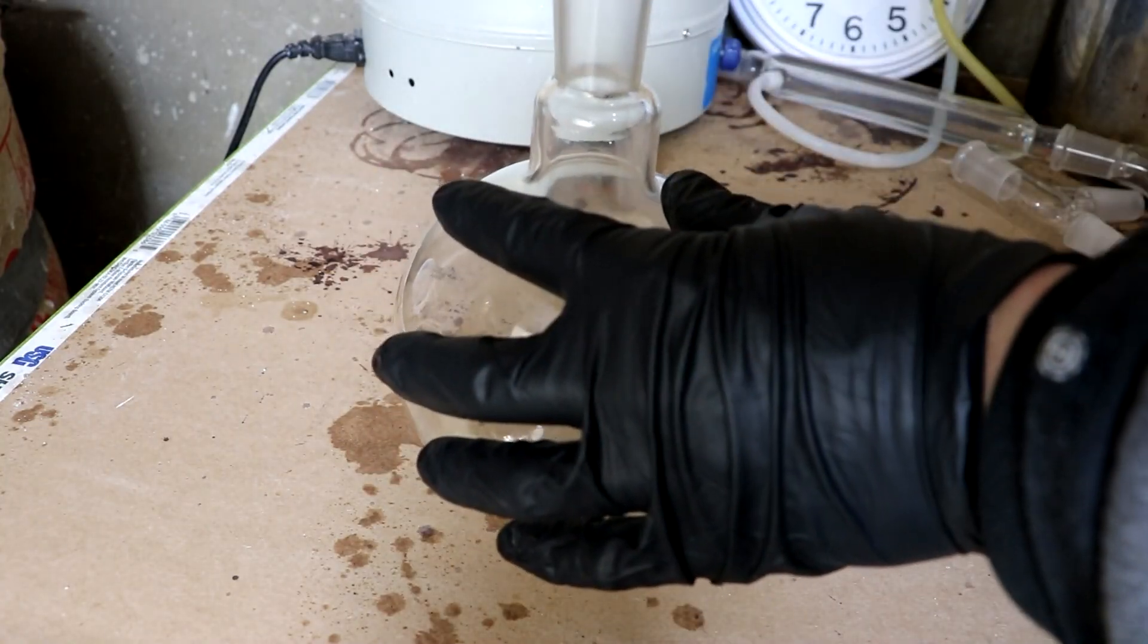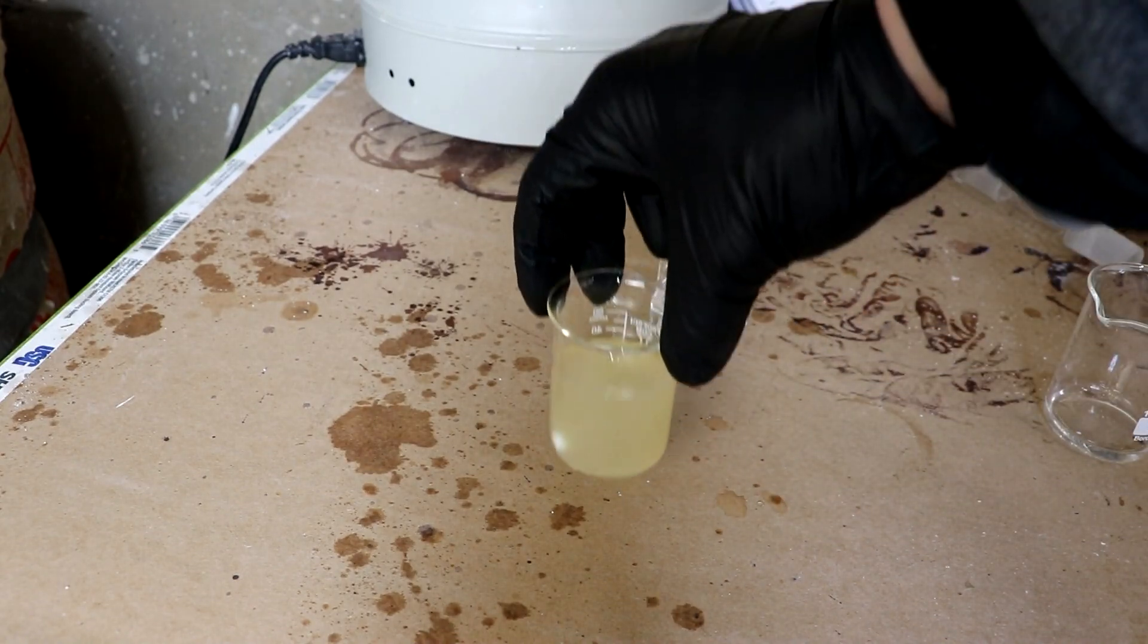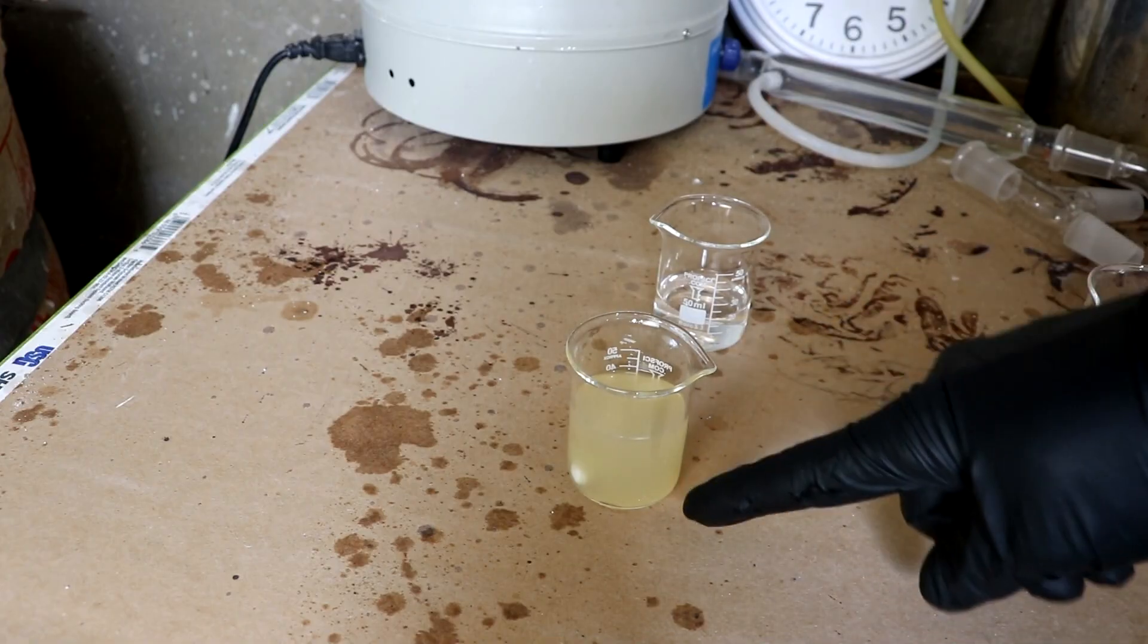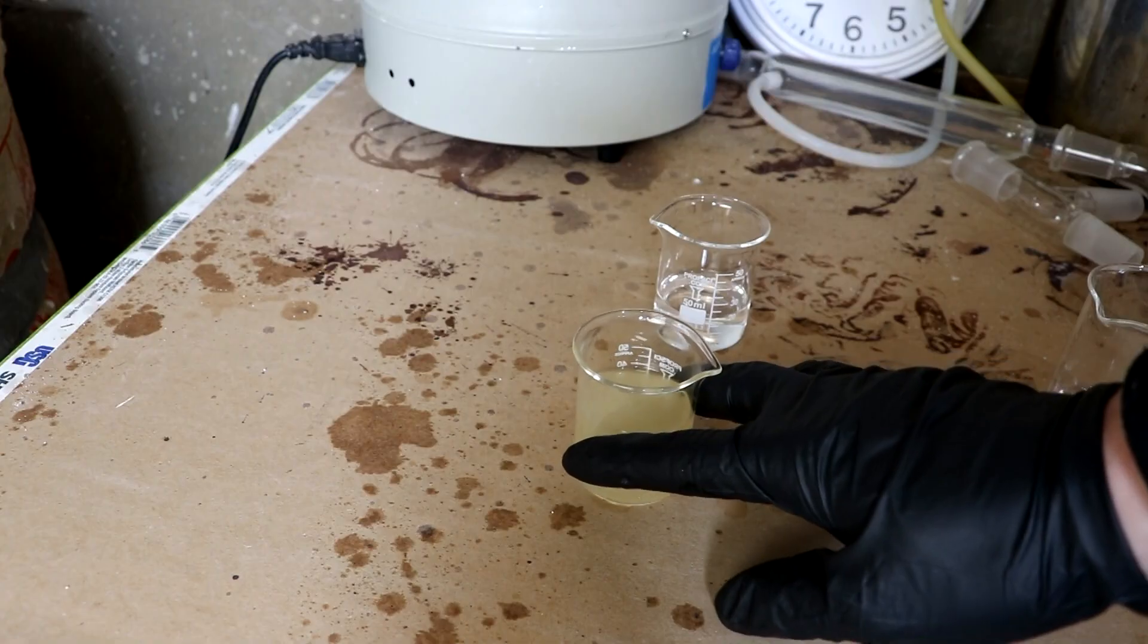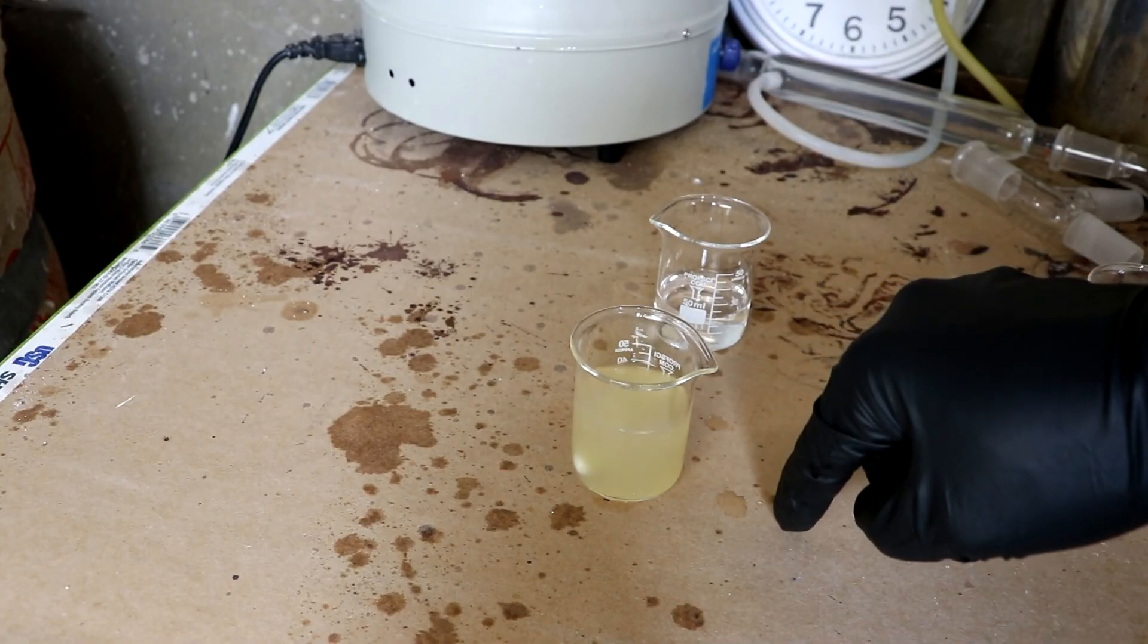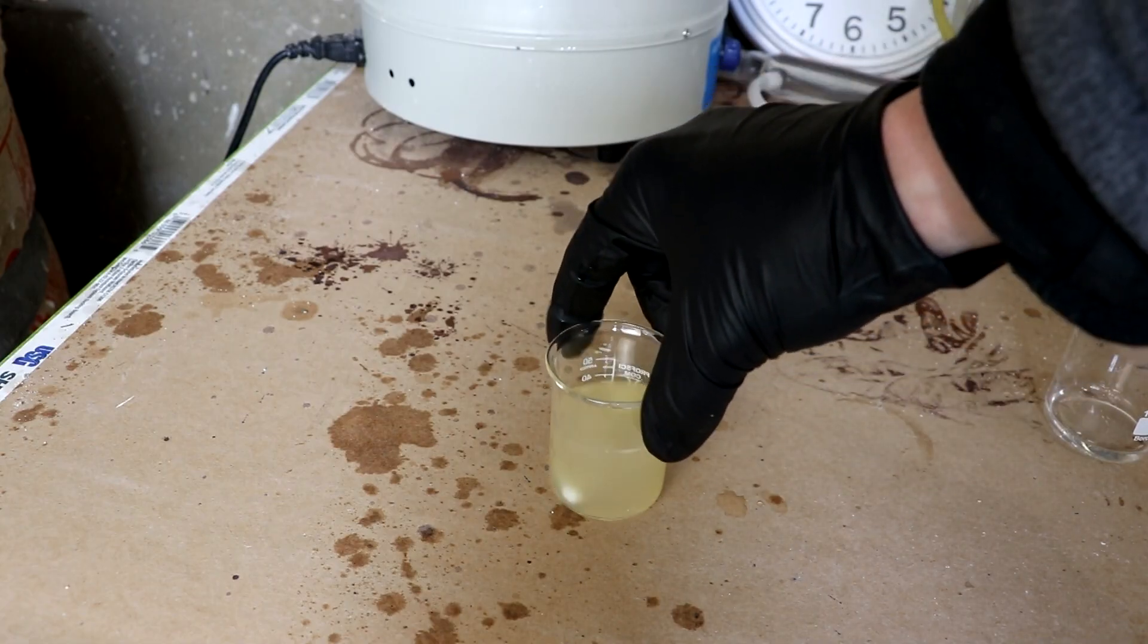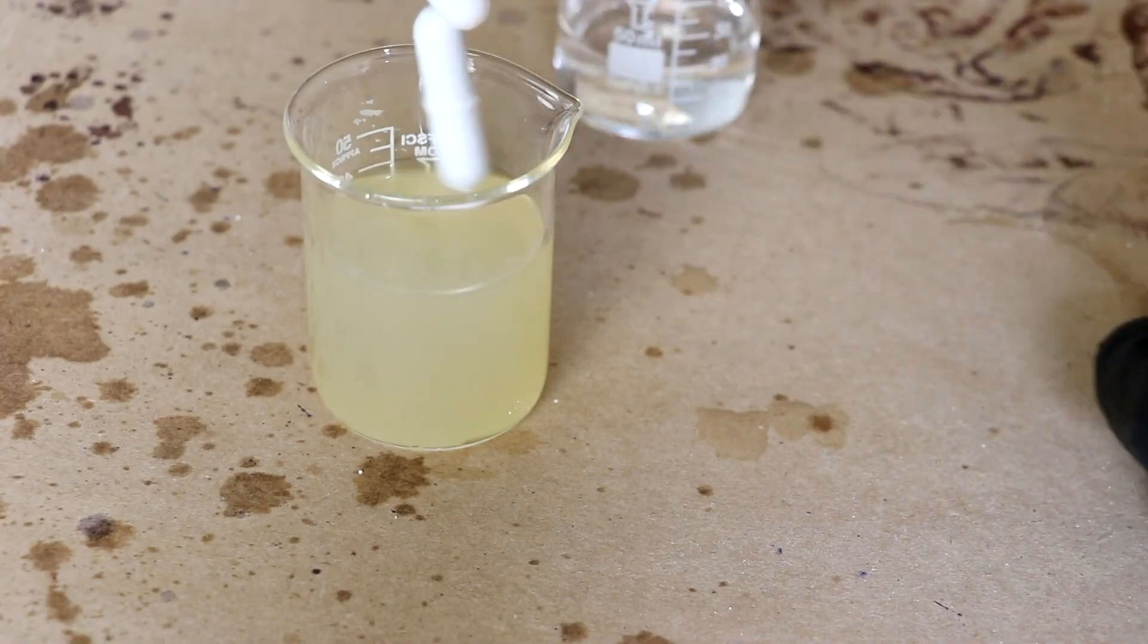Let's rinse it a couple of times. So now what I've got is a stir bar mixed with some sodium iodide, sodium chloride, because it's not completely insoluble. And, of course, a little bit of slightly burnt dextrose. So, it's a little bit of sugar water, probably.